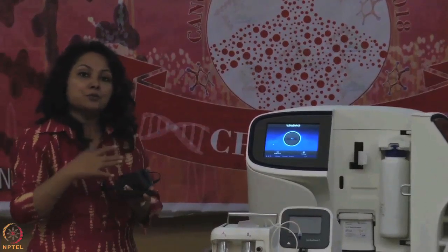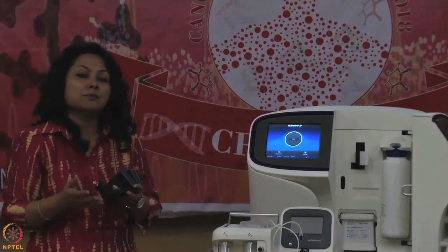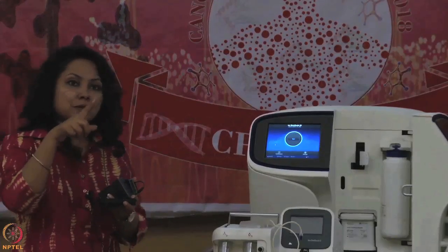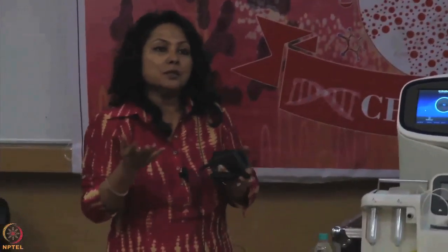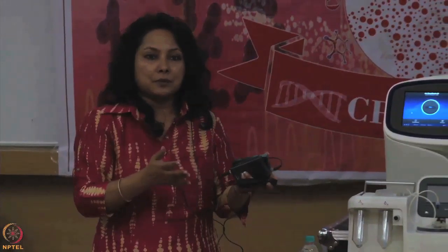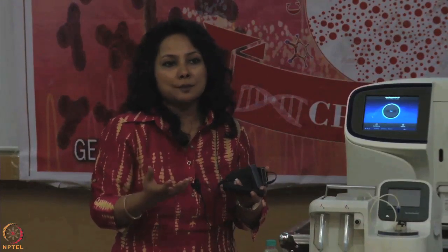This is the fastest system, which can produce a BAM file and finish your sequencing run within as little as 2.5 hours. There are various chip models from 510 to 550, with different read capacities. For ion chemistry, read lengths can go from 200 base pairs to 600 base pairs. Different read lengths are important for different kinds of experiments.